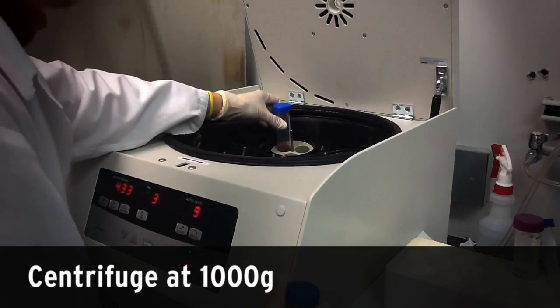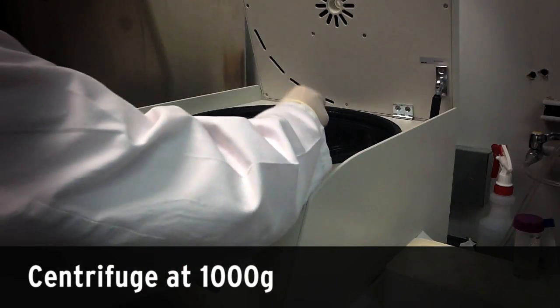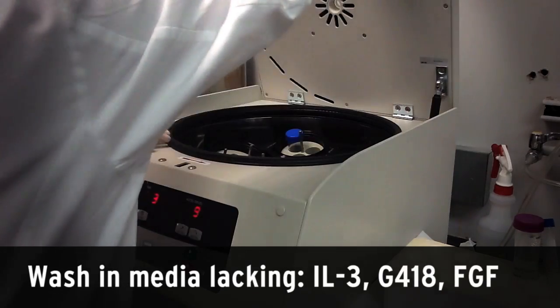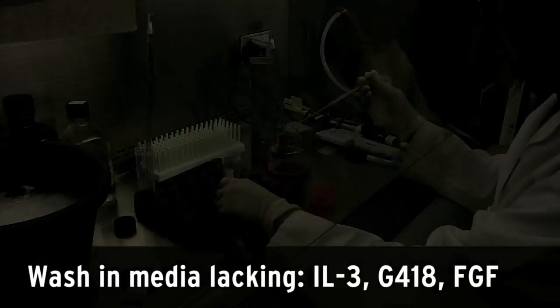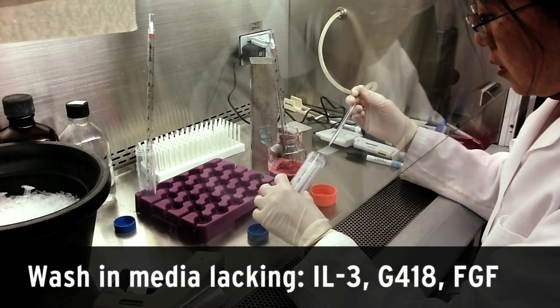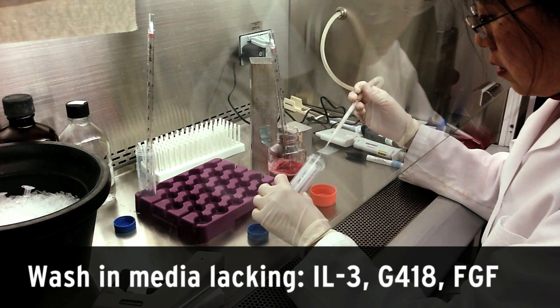Cells are centrifuged at 1000G and then washed twice with assay media lacking interleukin-3, G418, and FGF.